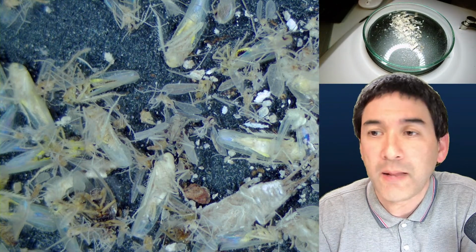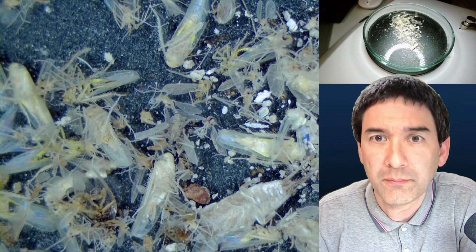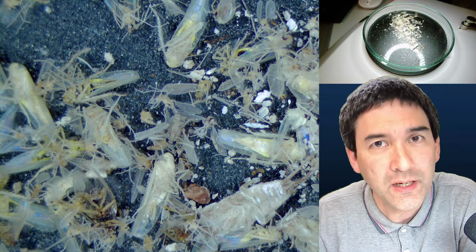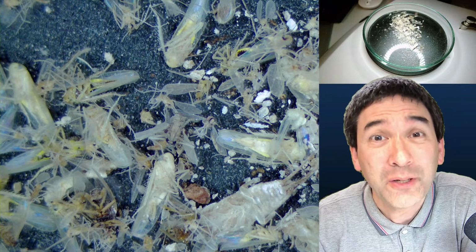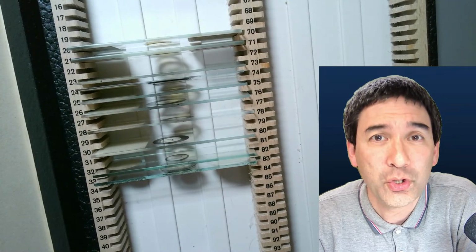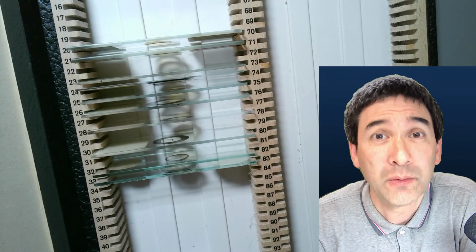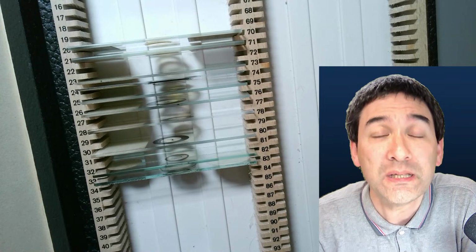So, a short view of what I wanted to do today. Last week I showed you some antique microscope slides that I bought, and we did not quite finish them. There are a few microscope slides that I have here now on my desk, which also contain some insects. And what I would like to do today is not only look at them, but I also would like to show you how it is possible to actually make a so-called stitched image.